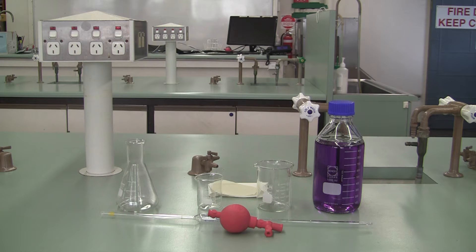All right, time to talk about how to use your bulb pipette. Learning to do this means that you'll be able to deliver accurate and precise aliquots of a sample solution.